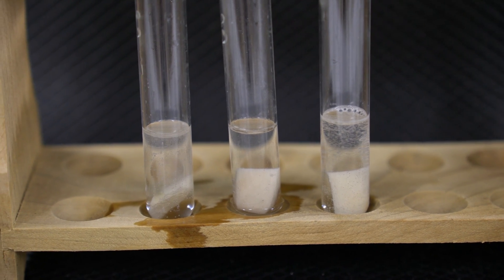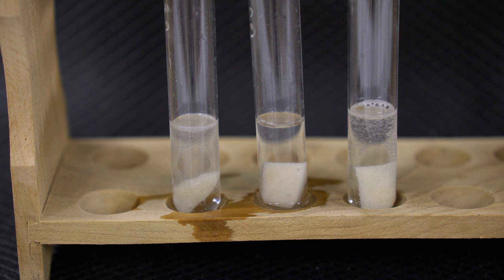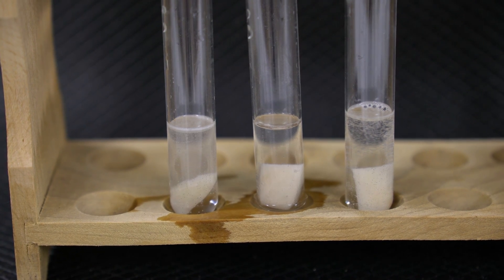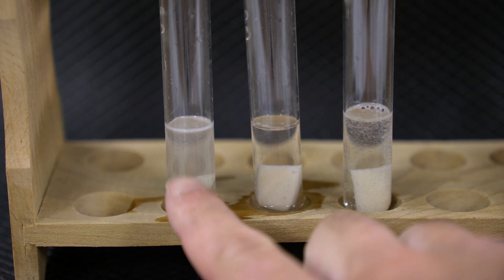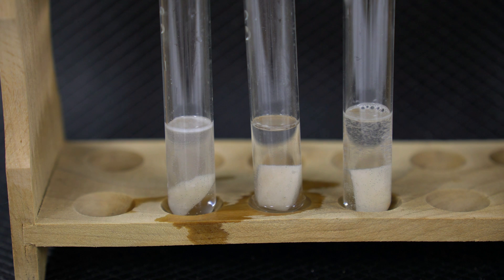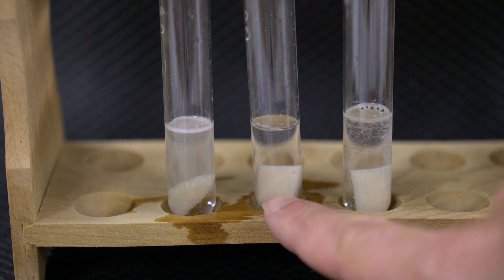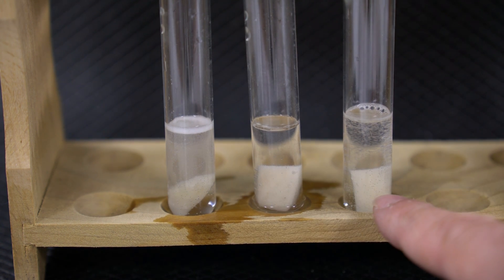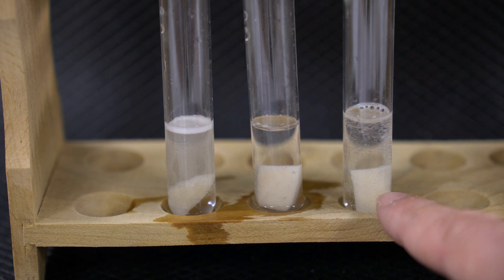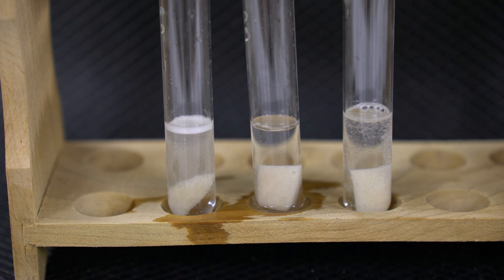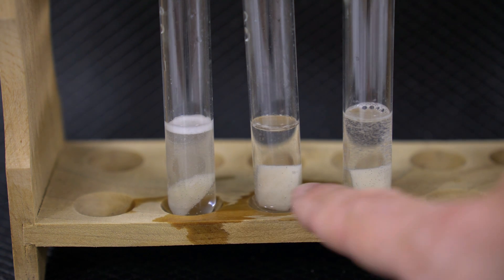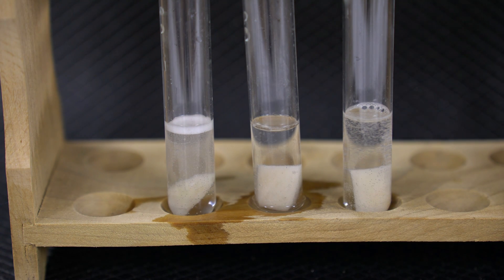We then added fresh hydrogen peroxide. Here was the decanted hydrogen peroxide that had gone through the reaction, with a fresh piece of potato. And again, these two are reacting somewhat, but definitely much reduced now compared to the original.